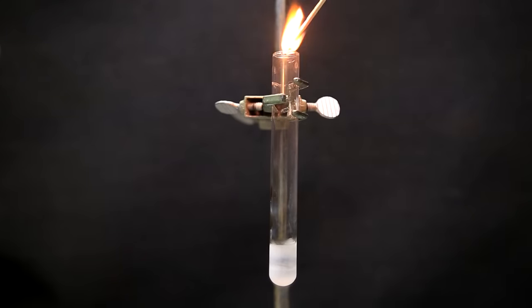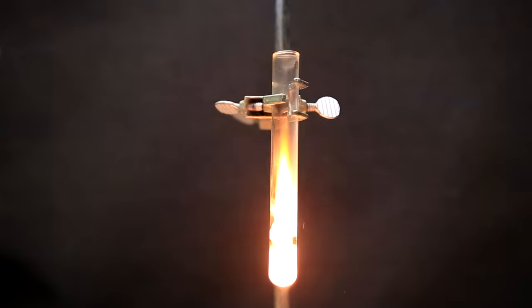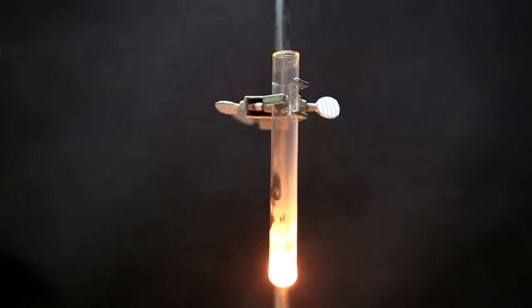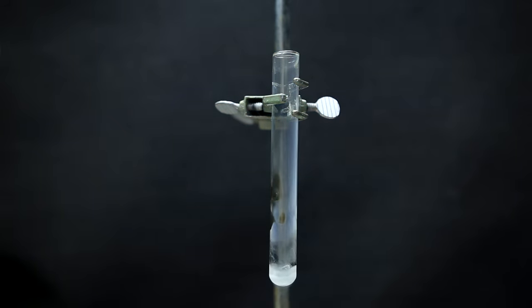While I'll just be playing with the liquid oxygen and testing out some of its properties, it does have practical applications. I won't really be covering its uses, but I thought one interesting one was as a liquid oxidizer for spacecraft. Anyway, that's enough of an intro and let's get to making some.